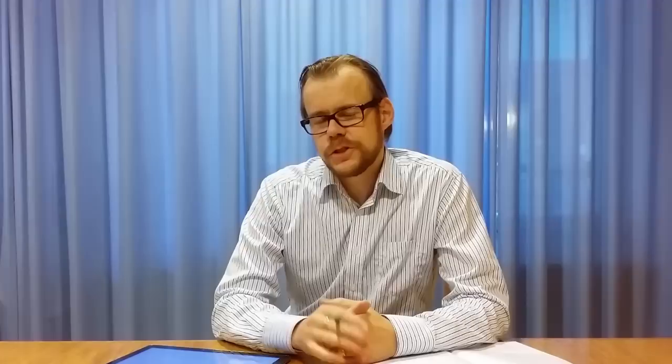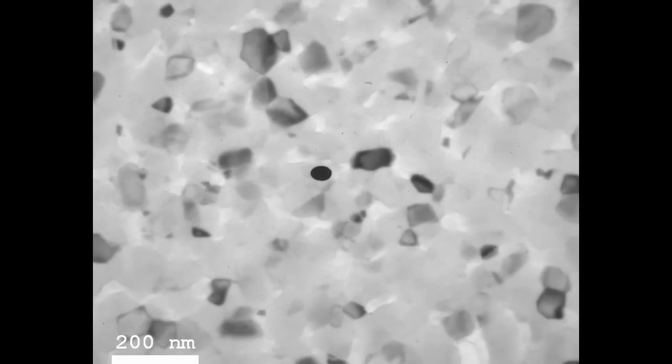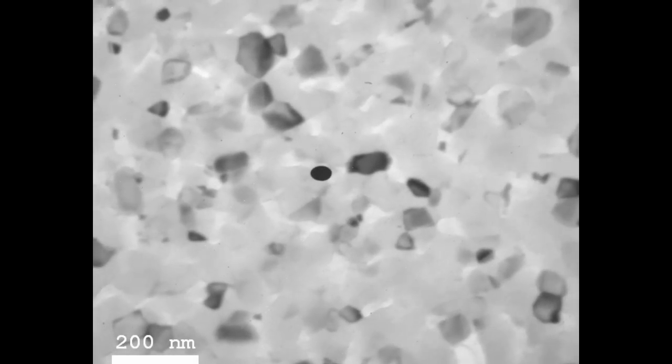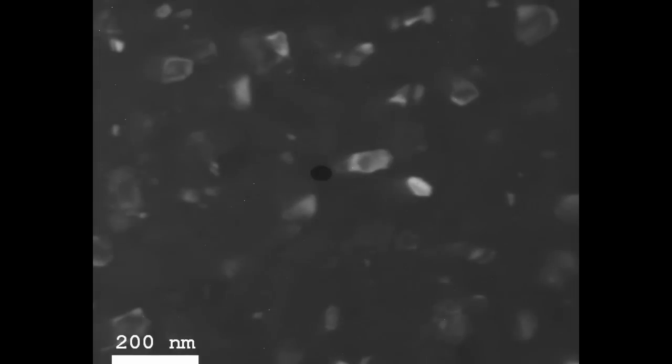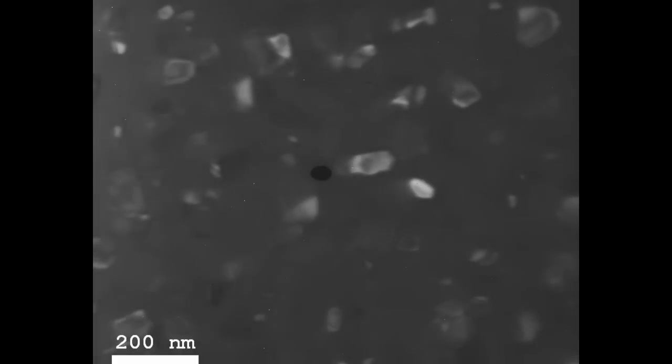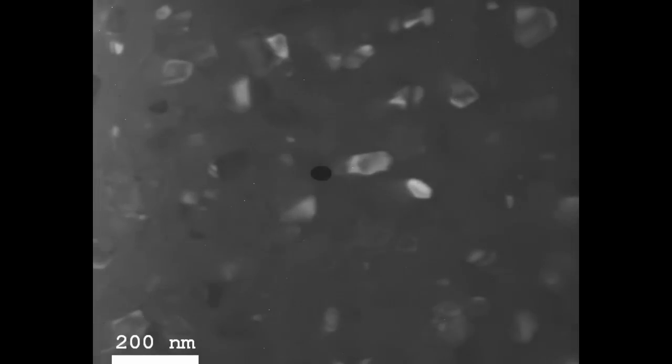We can instead choose to view some of those deflected electrons and block out the central beam — the bright field beam — to get the dark field imaging view. This is somewhat comparable to dark field in light microscopy. In the dark field view, everything is reversed: we pick up the deflected electrons satisfying the Bragg condition, and those regions become white.